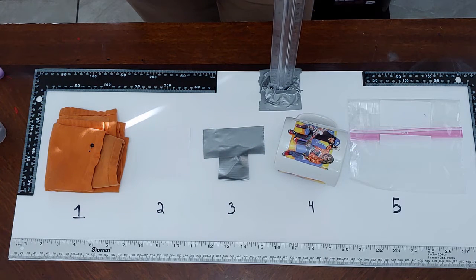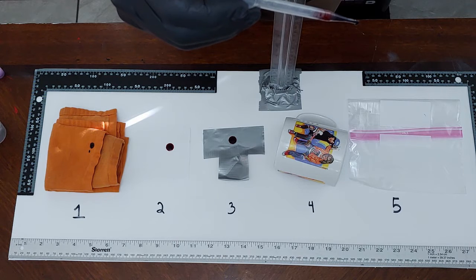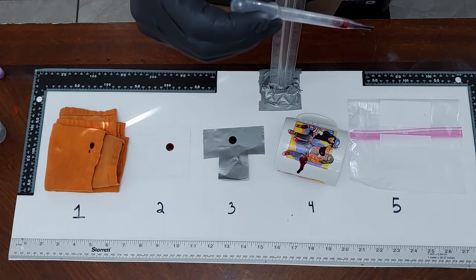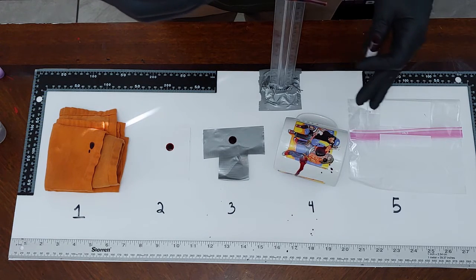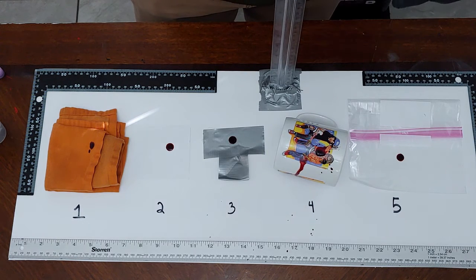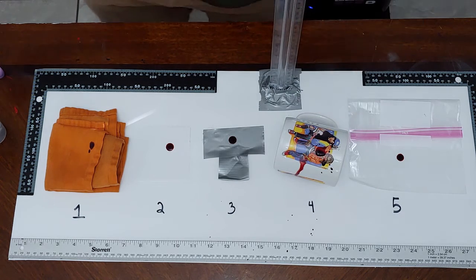So first is the cloth material. Second is just like a textured paper. Third is duct tape. Duct tape, you find those in scenes. Sometimes people are bound with it. So always look on duct tape to see if you can find any blood stains. On our Wayne's World cup, we're going to do a couple drip stains. I want to demonstrate something else with this later. Okay, this is a nice smooth, polished, clean surface. And then our last one is the plastic bag. Okay, so I'm going to save the rest of that blood. This is my own blood, so I'm trying not to draw my blood unless I have to.